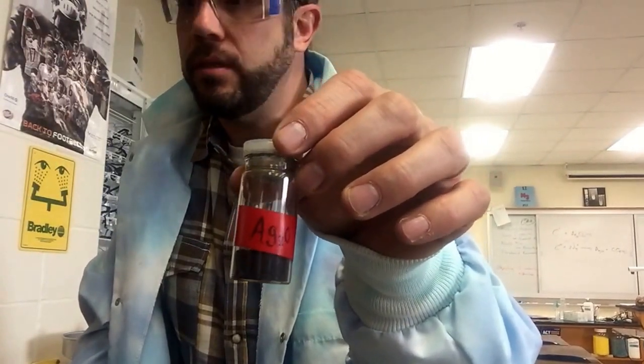Hi, this is Mr. Scott, and I'm going to show you how to do pyrometallurgy — the process by which we're going to take this silver oxide powder and turn it into the silver metal that you know and love. So let me show you that process as we get started.